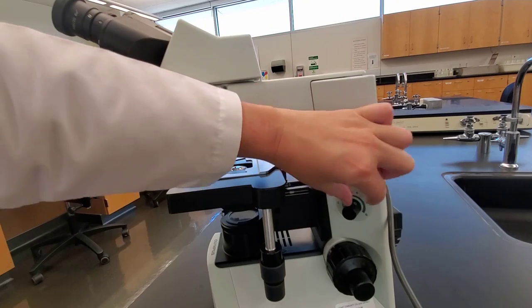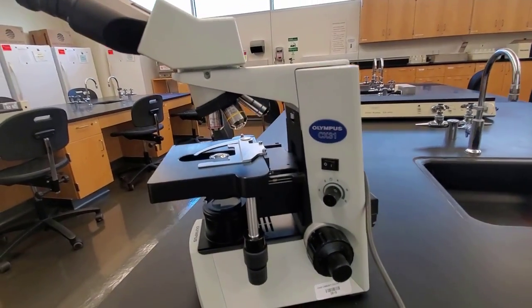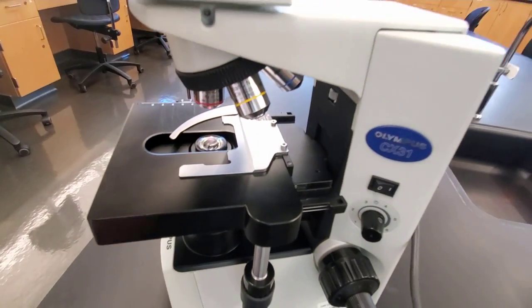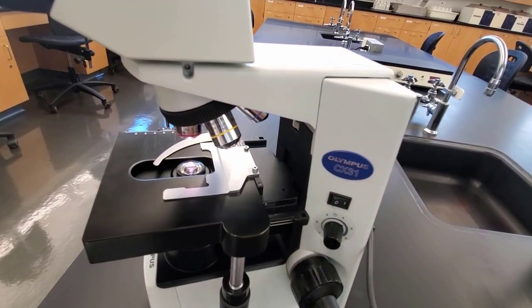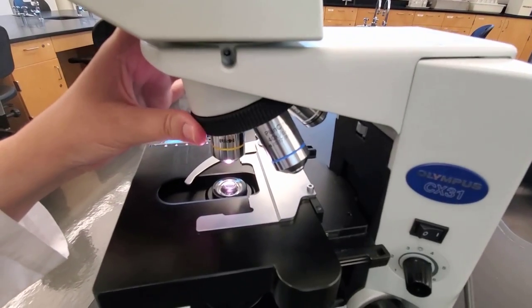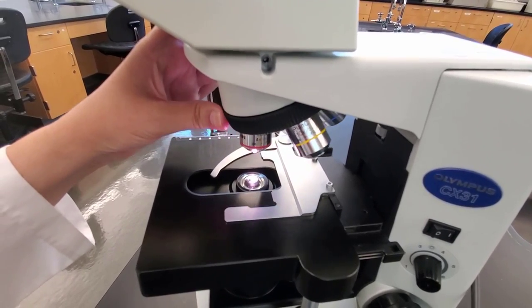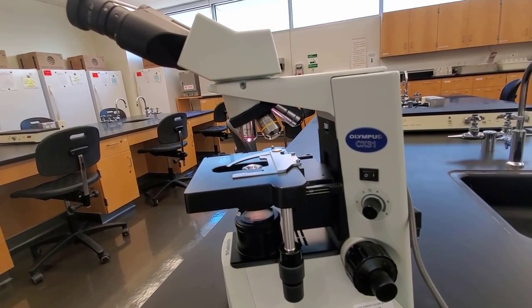We want to make sure the light intensity is all the way down before turning on the microscope. Once confirmed, we turn the switch on. We then increase our light intensity to about 4 so we can see more light. We want to start with our scanning lens — the 4x objective — snapped into place.